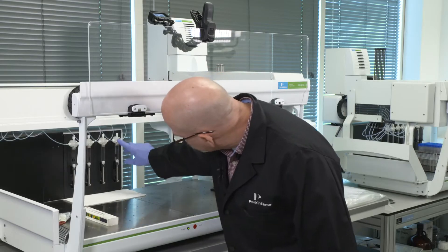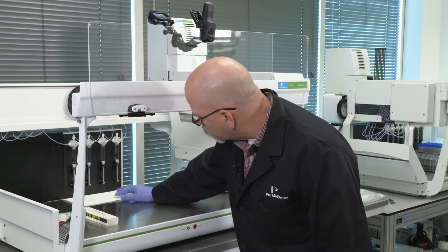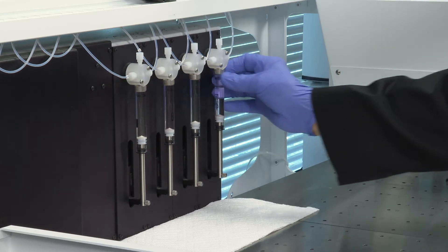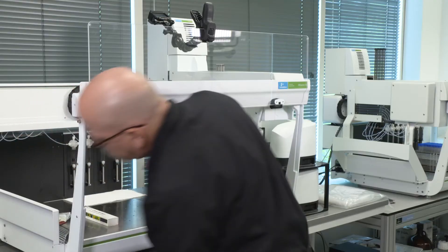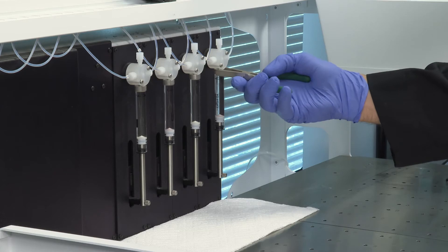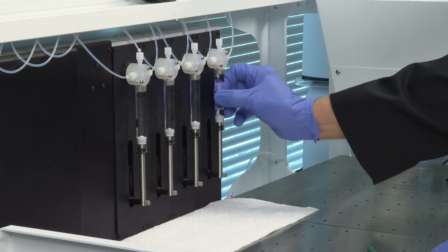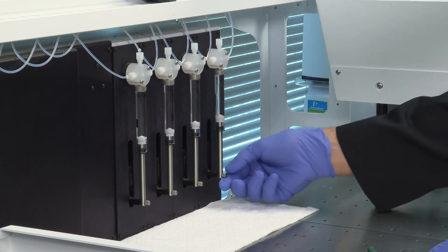When you loosen the syringe, there will be some heptane spillage, so use a paper towel. Loosen the syringe, and if it's too tight, you can use a pair of duckbill pliers or something similar. Very carefully, without slipping, rotate it counterclockwise to loosen the syringe.